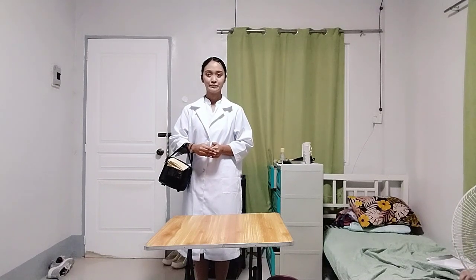And for today's video, I'll demonstrate how to perform Benedict's test. And for the assessment, determine the need for Benedict's test.